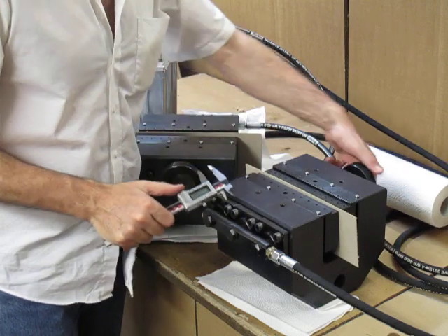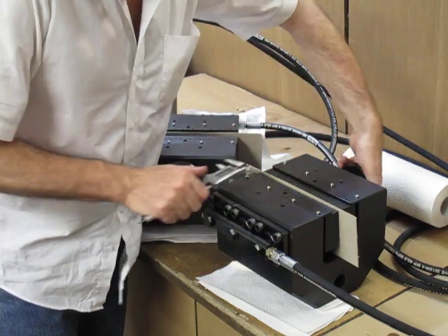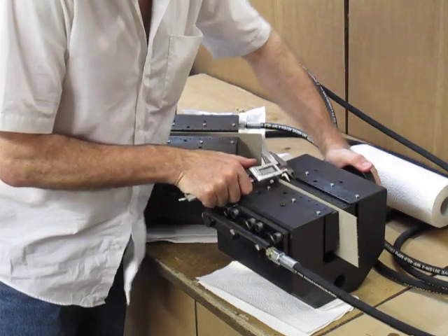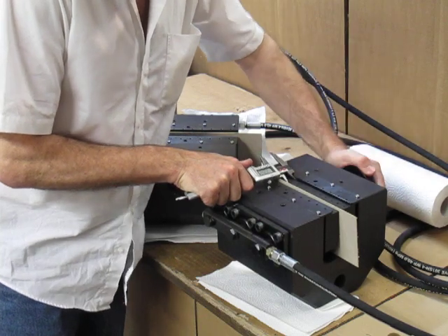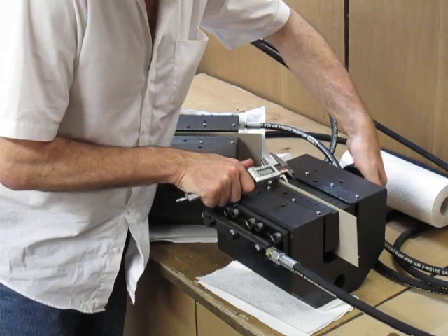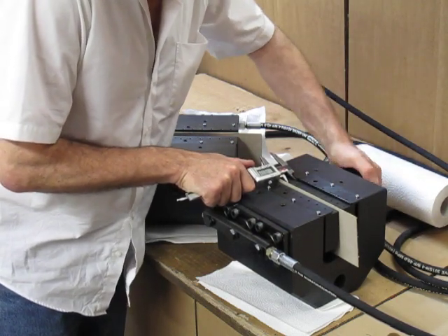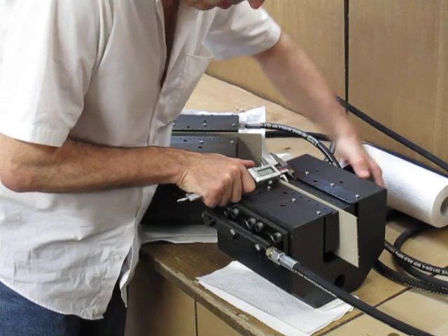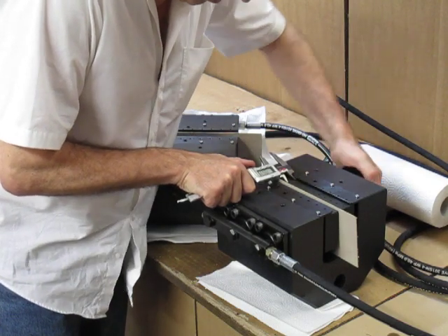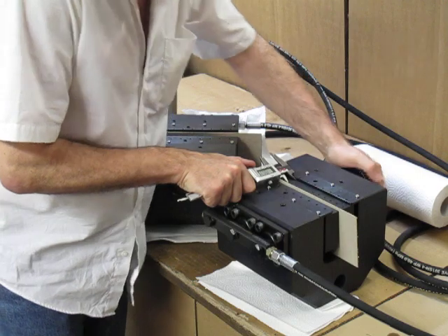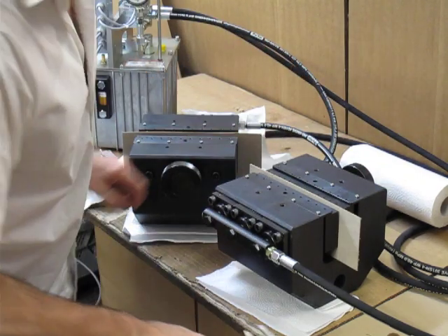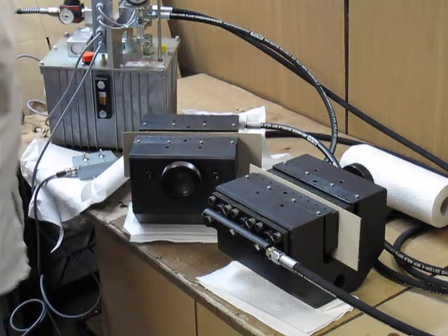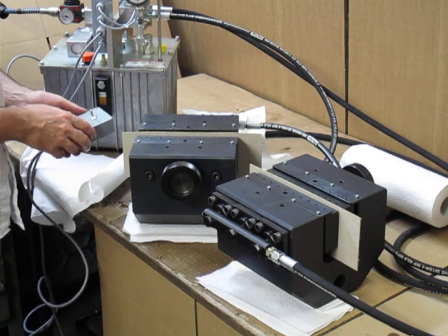I move this to your side, to 19.5 mm. And now I close this grip.